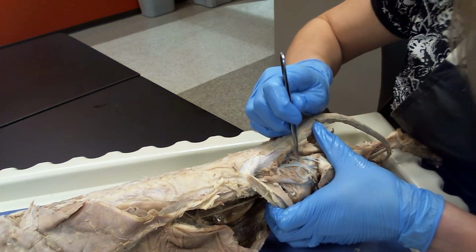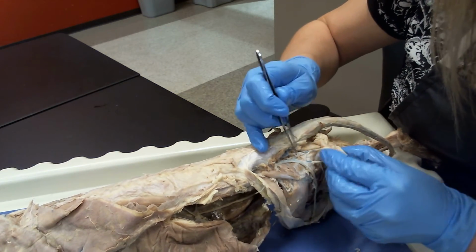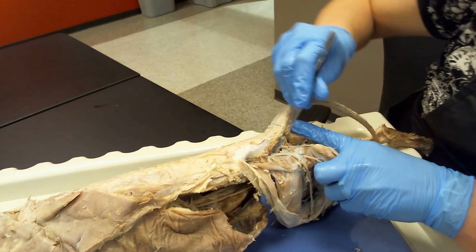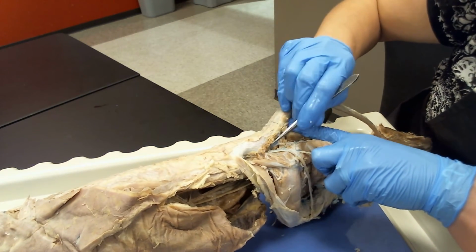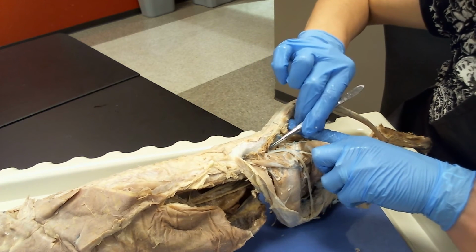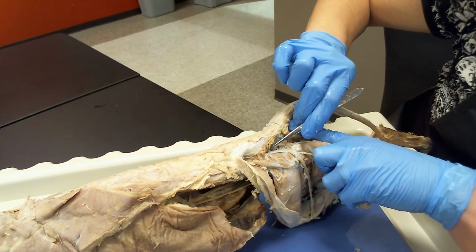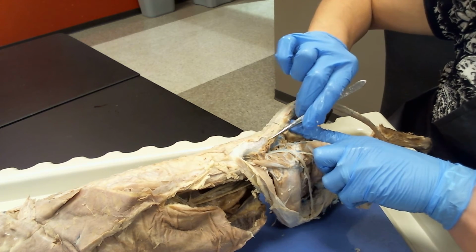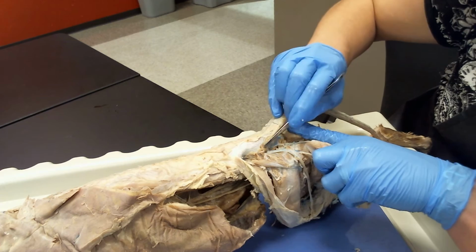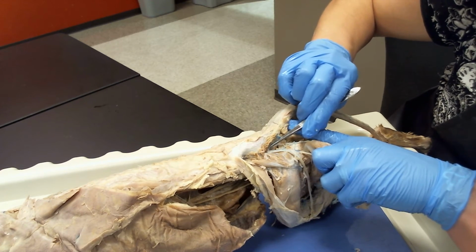And then as we come on back, if we found our superior gluteals, it would make sense we want to find our inferior or caudal gluteal. So this particular cat, we had cut those muscles off completely, but you can appreciate there's a nerve right there coming off and diving in. If we still had these muscles right here, we'd be able to flip it up and we could see the caudal or posterior gluteal nerve a lot easier.